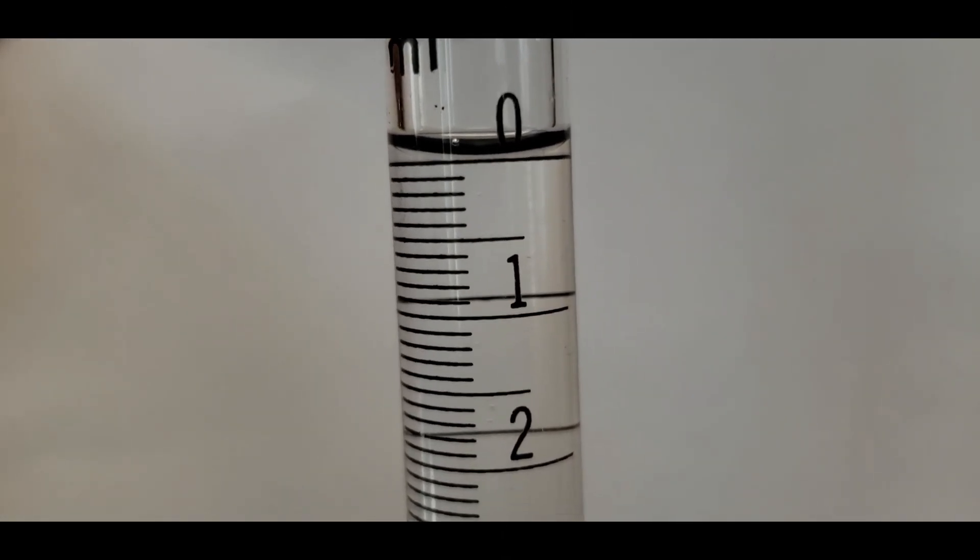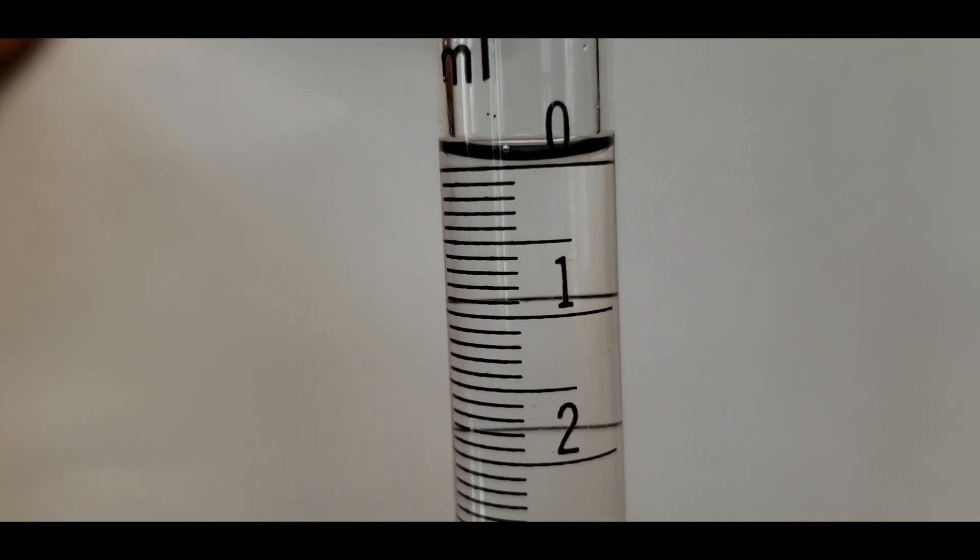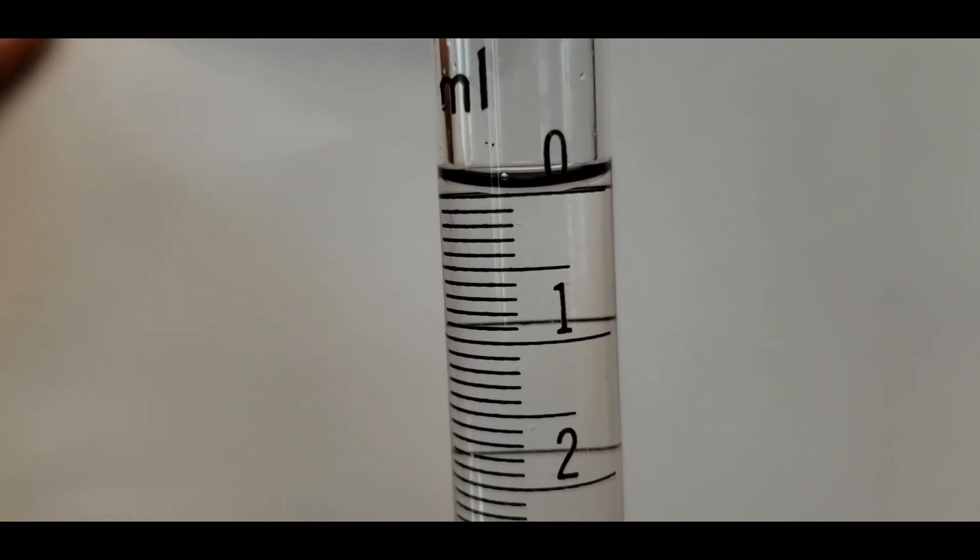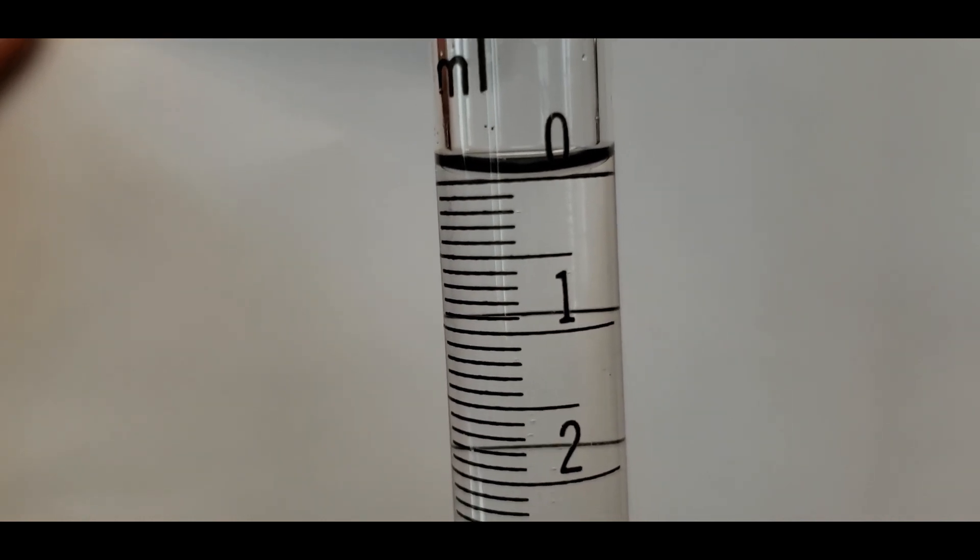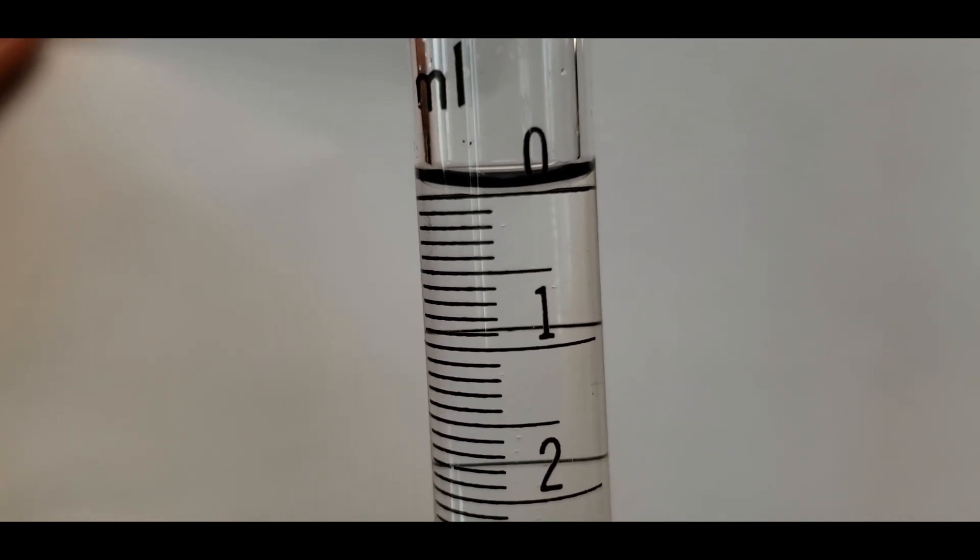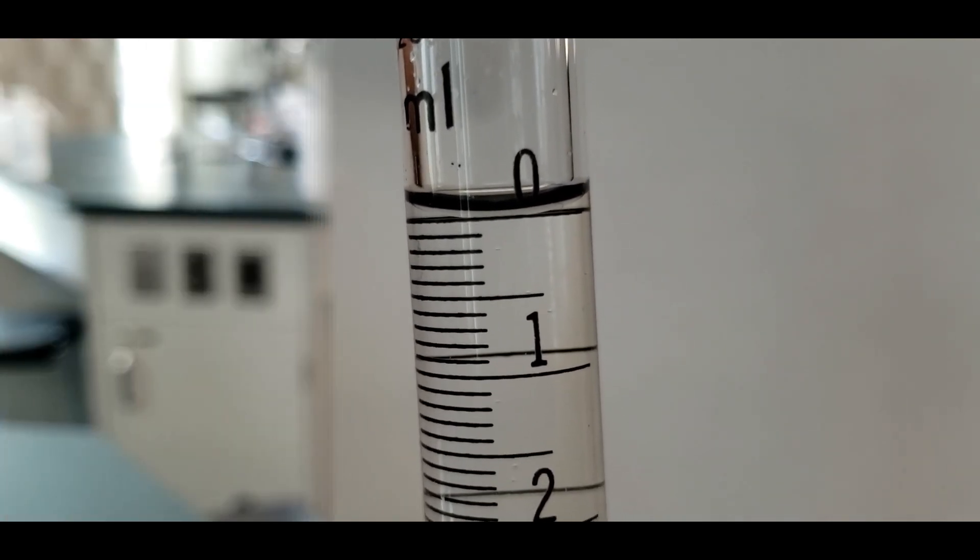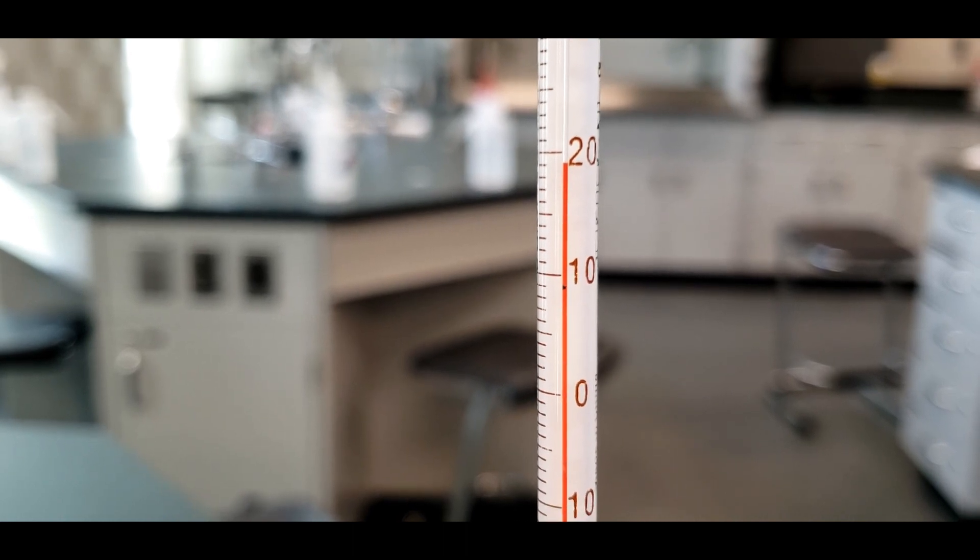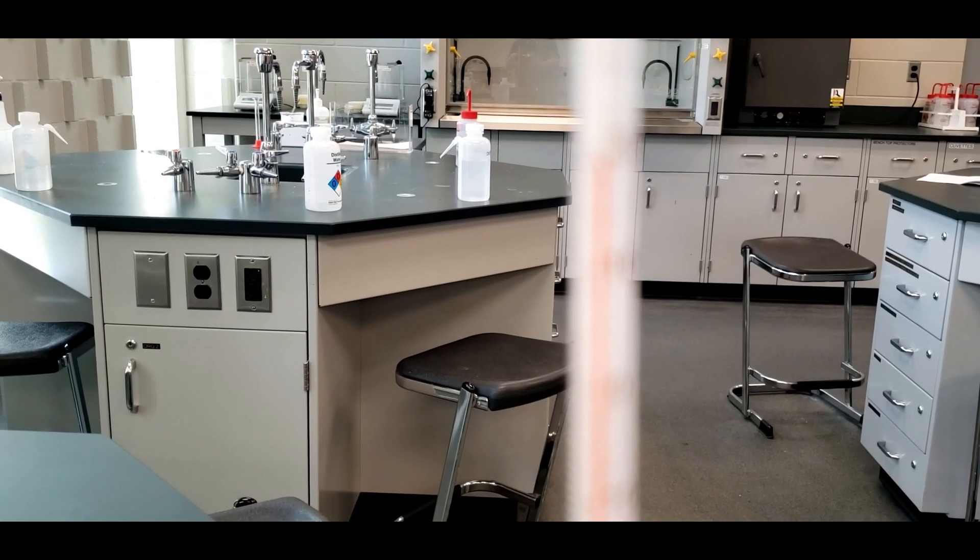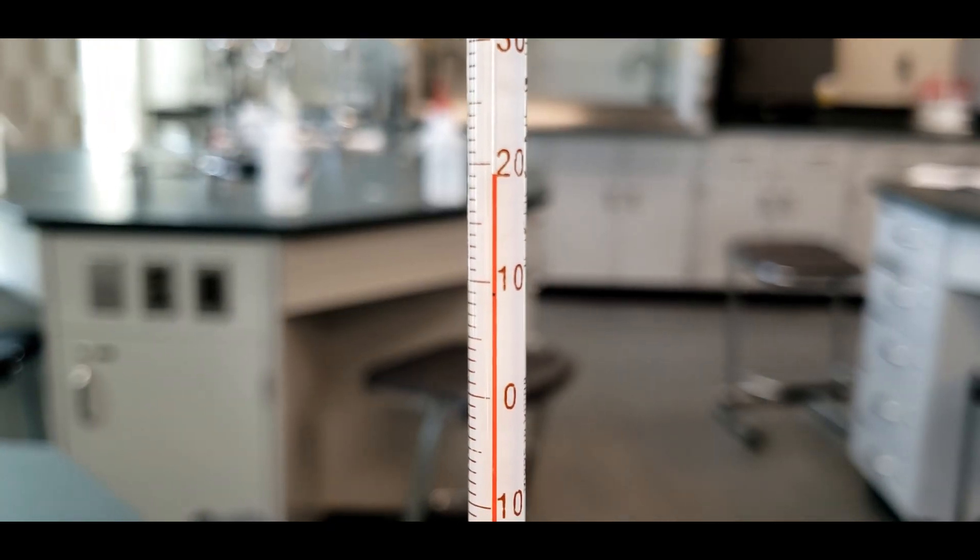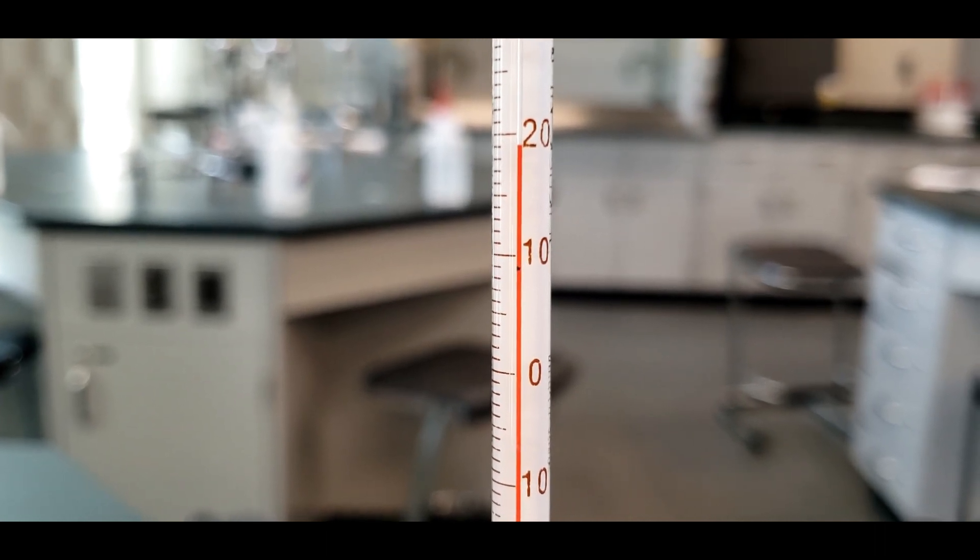Here's the starting volume of the sodium thiosulfate I've added to the burette. You can see it's a little bit above zero. I'm going to have to empty out probably like two drops or something to get it to there. And that will, for each titration that we do, all eight of them, I'm going to start at zero for our initial volume. So for your report sheet where it says initial volume, you can just write 0.00 mL. Since the equilibrium constant will change with temperature, it's always good to know where you start temperature-wise. So it's like a little bit above 19, maybe 19.1 degrees Celsius.